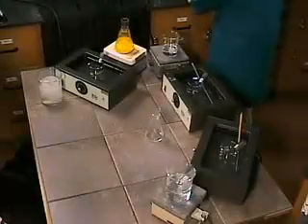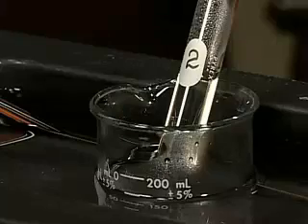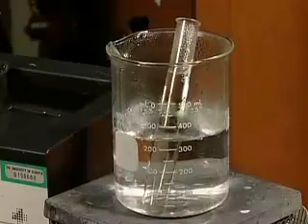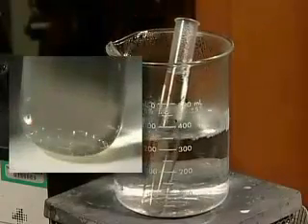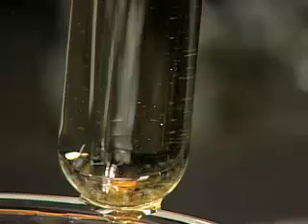The test tubes remain undisturbed for 1 hour. What does this passage of time ensure? Compare the contents of the test tube in the boiling water bath to the cold water bath. Based on your observations, what initial interpretation can be made?